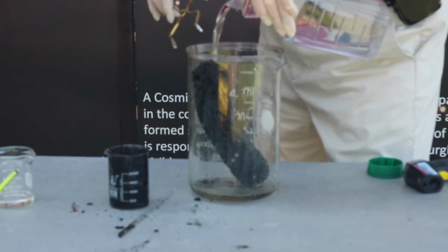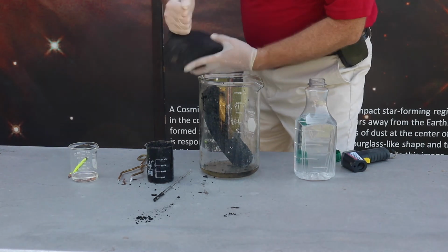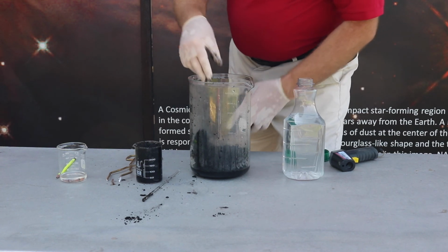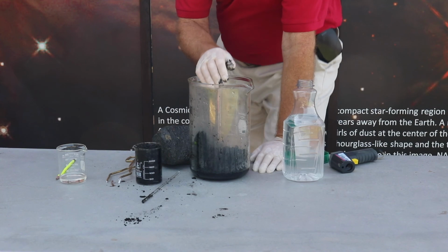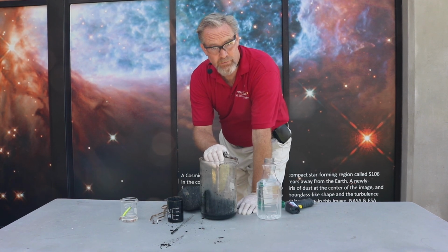It's not going to dissolve. But again, if I squeeze this charcoal, it's not going anywhere. It's very, very tough. This stuff, on the other hand, just smashes apart. It's very, very non-dense. But again, we have pure carbon left over after the water's come out of sugar.